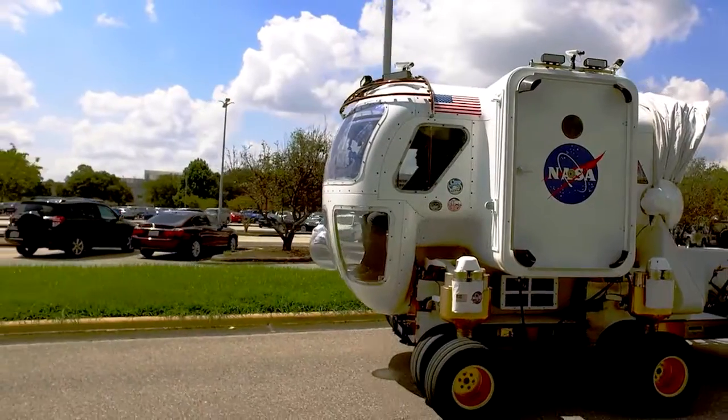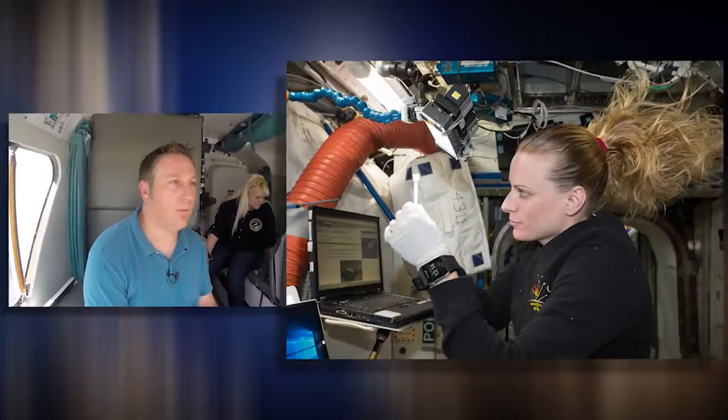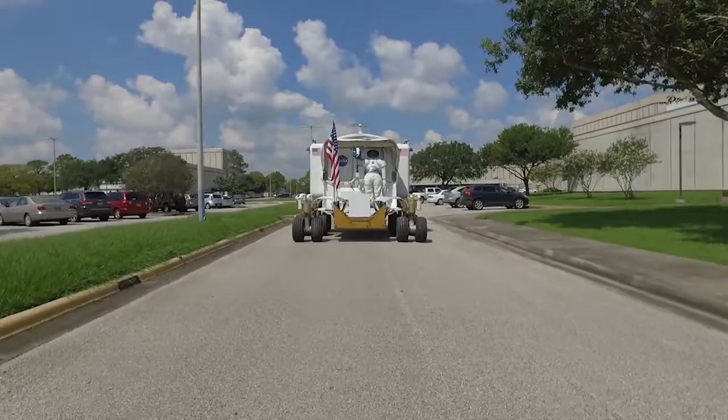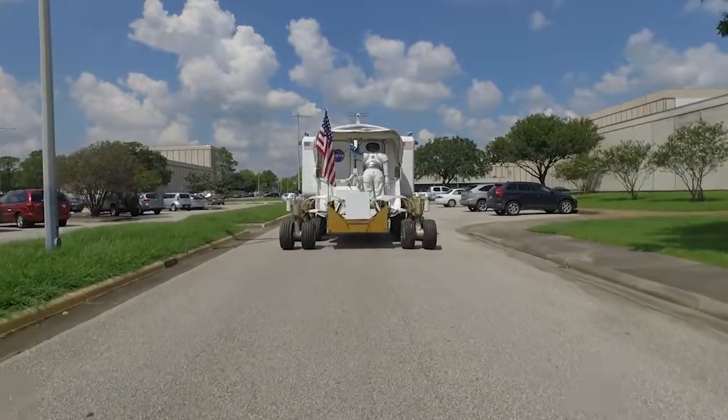All right, so we've sequenced DNA underwater. We've now done it in a rover, but this thing's in space right now. Like, how has it been working in space? From what we can tell so far, it's working even better in space. So we've really exceeded our wildest expectations. We actually had a pretty big milestone the other day where we passed our billionth base of DNA sequenced in space. Wait, billion with a B? Yes, billion with a B. So the human genome is about 3 billion base pairs. And so for us to get a billion bases in space really gets us on that same scale, which is pretty amazing.